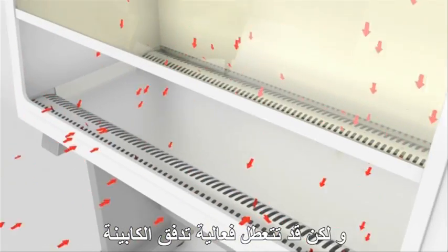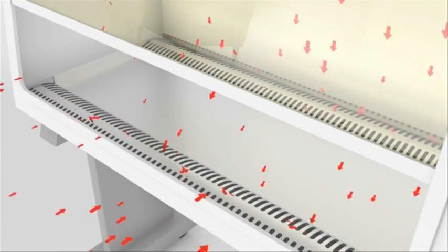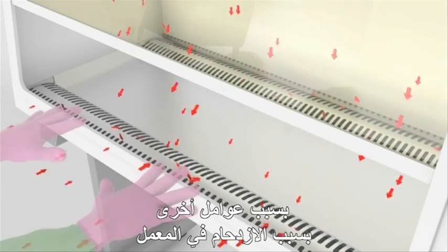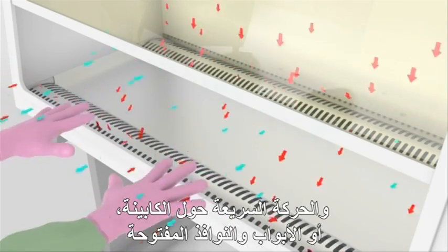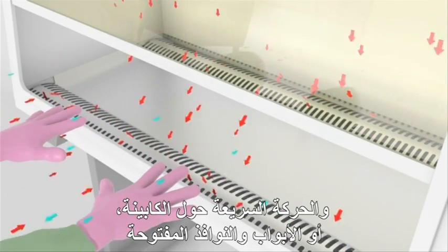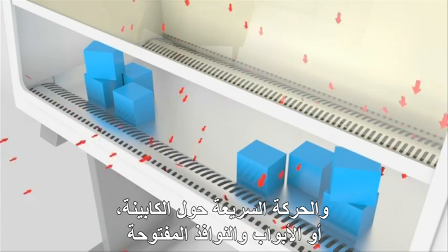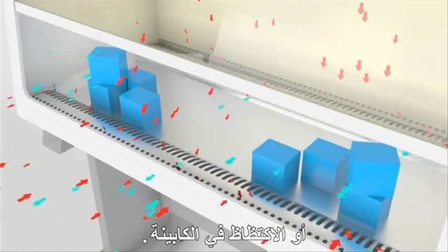The efficiency of the cabinet air flow can be compromised by other factors such as overcrowding in the lab, rapid movement around the cabinet, open doors and windows, and overcrowding in the cabinet.